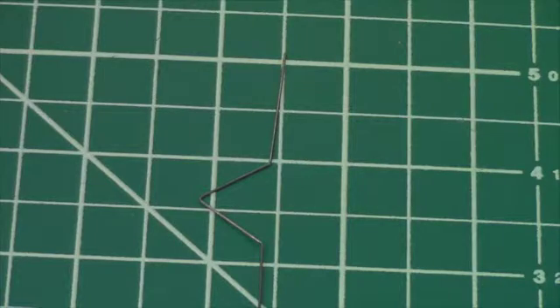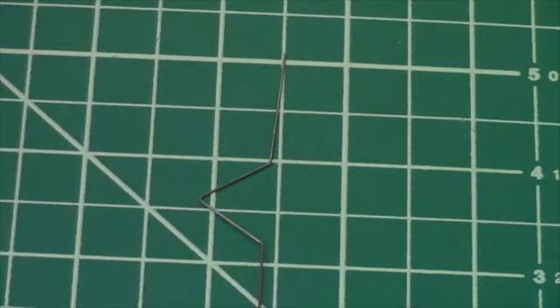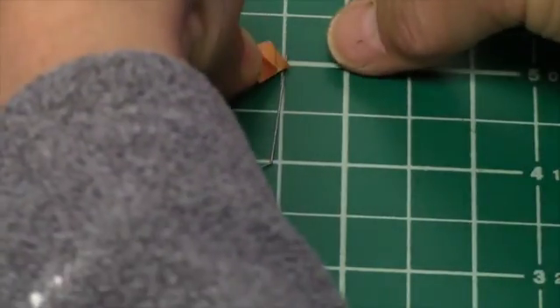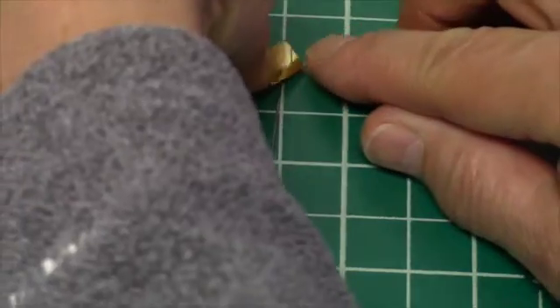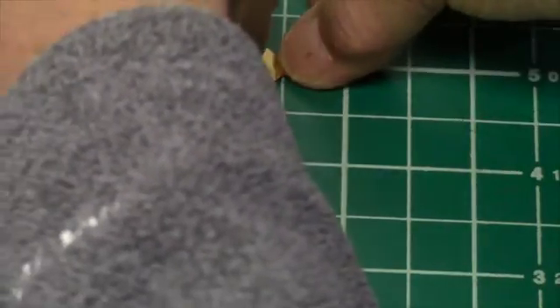Now that I've scribed the sample, I'm going to cleave this over a straight pin. In this case, I'm using a tungsten wire.